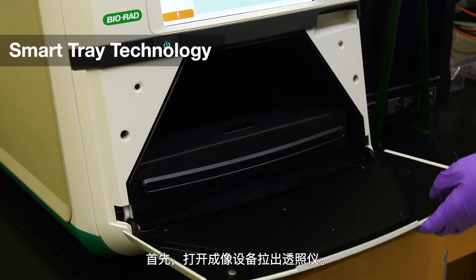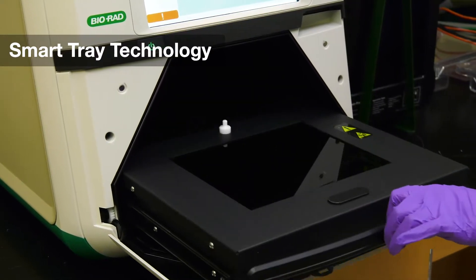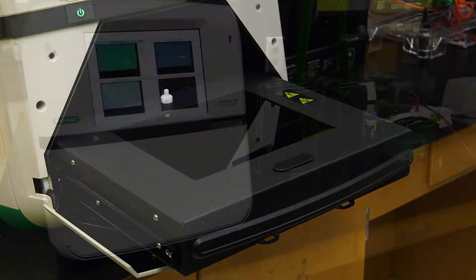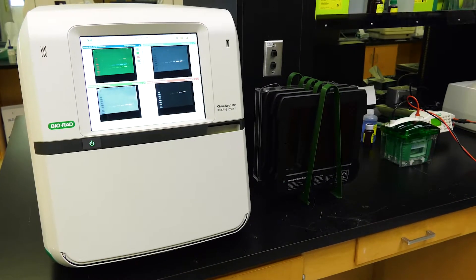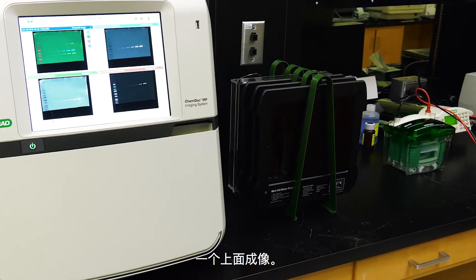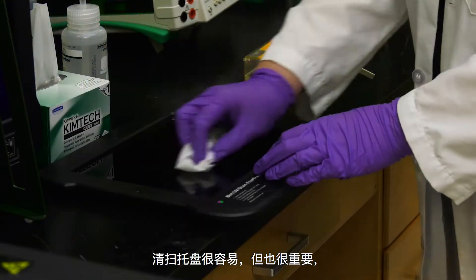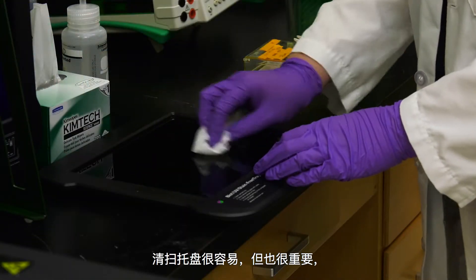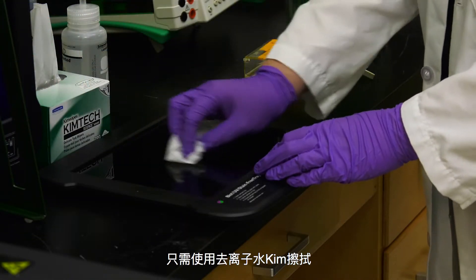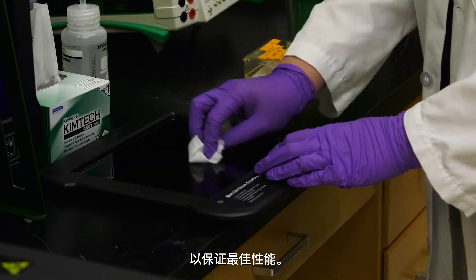To begin, open the imager and pull out the transilluminator. Note that all gels and blots will always be imaged on one of three trays. It is easy but important to clean the trays — simply use DI water and a Kim wipe to ensure optimal performance.